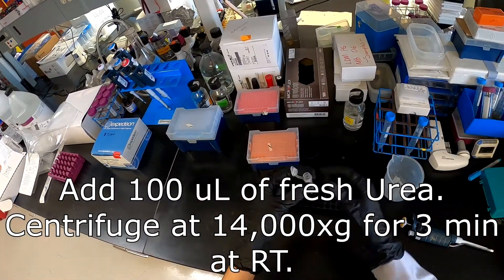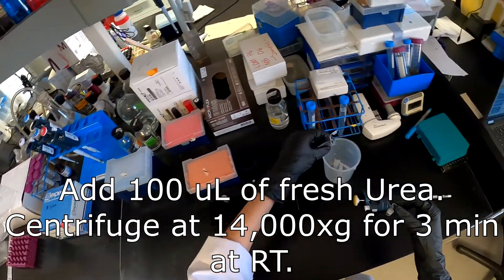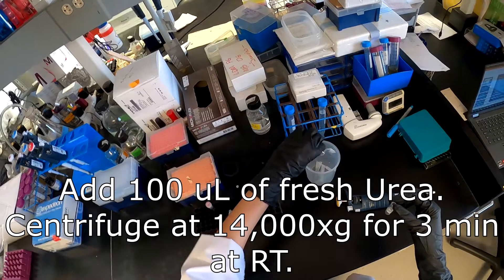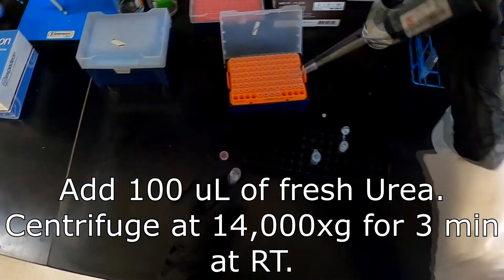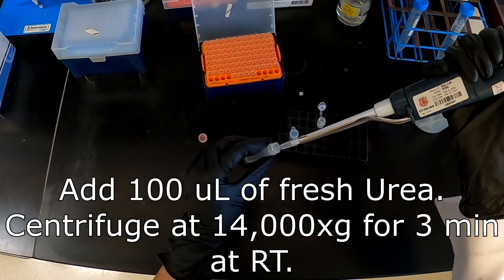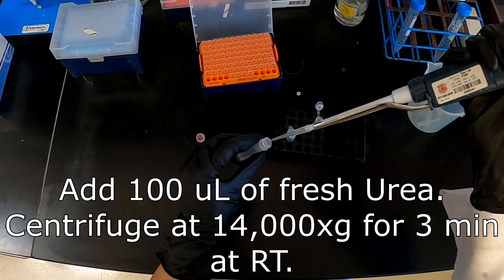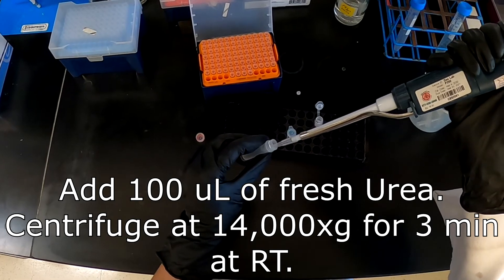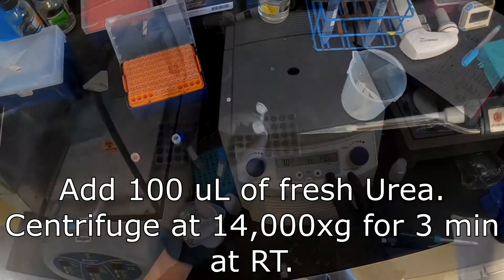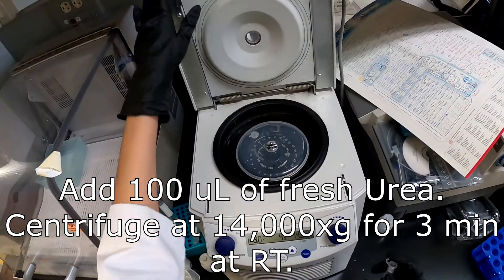After this, 100 microliters of fresh urea was added to the filter. It was then centrifuged at 14,000 G for 3 minutes at room temperature. The reason why we need to perform a lot of urea washes is to be sure that the proteins are efficiently solubilized.